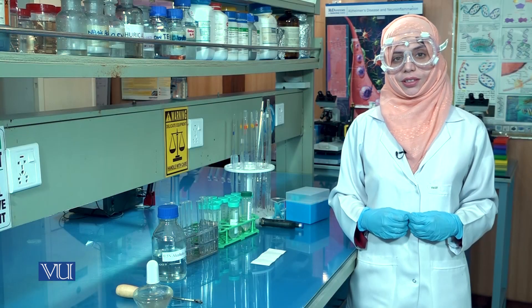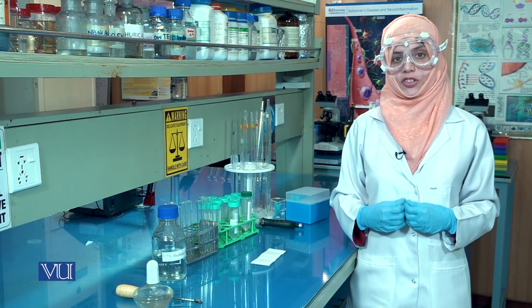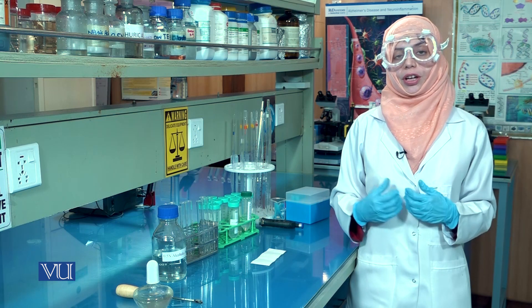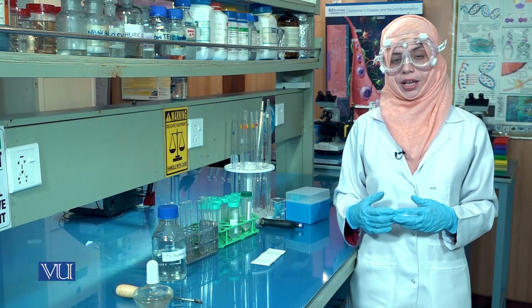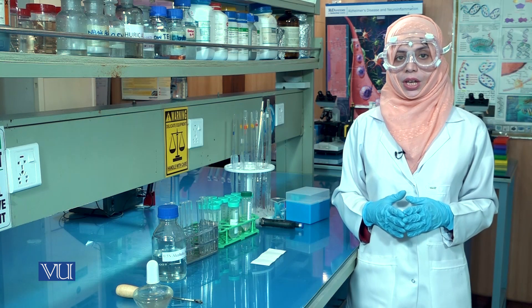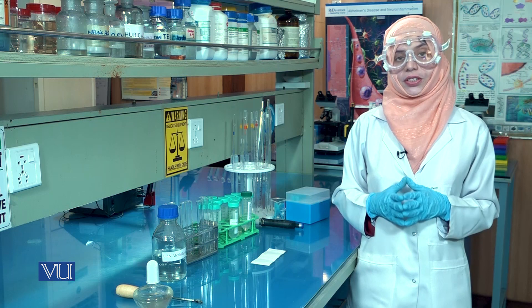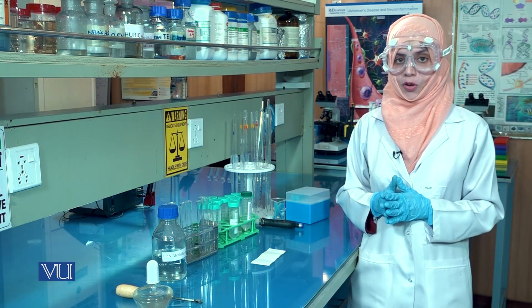Dear students, lipids are a class of heterogeneous compounds that contain hydrocarbons and include fats, oils, steroids, waxes and their derivatives. To identify whether a sample contains a lipid or not, there are certain tests that we use in the biochemistry laboratory.